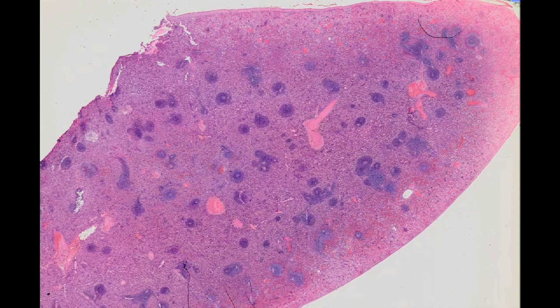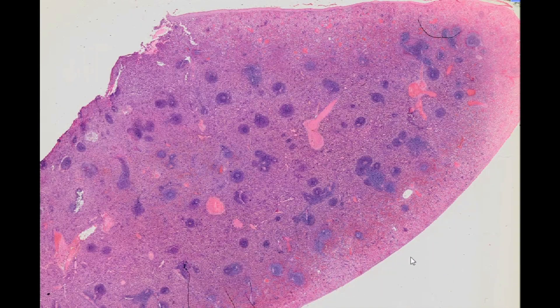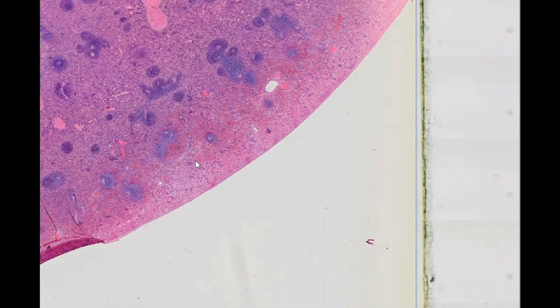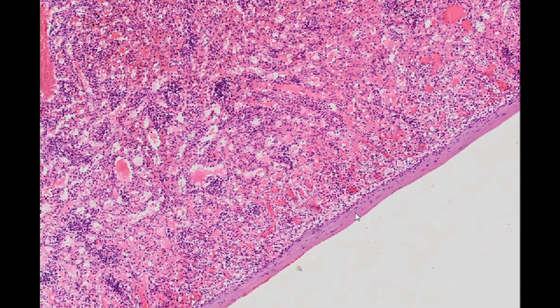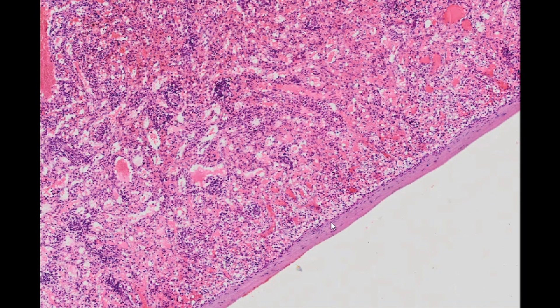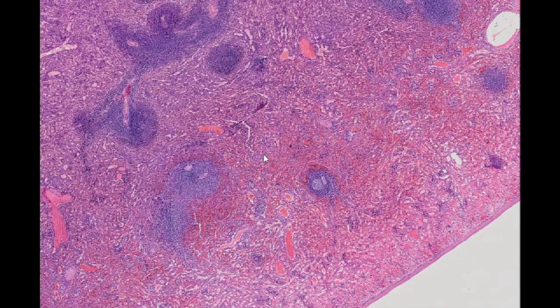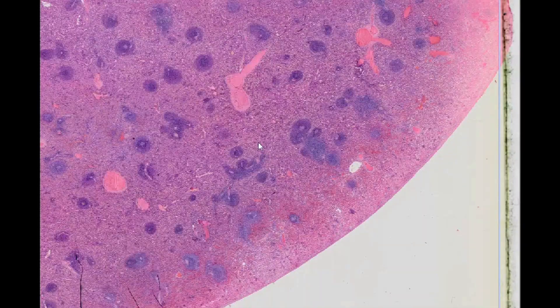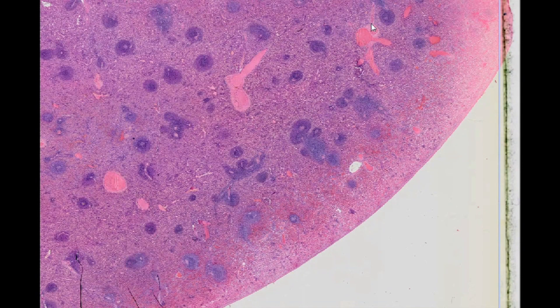Spleen. H&E staining. The spleen is a peripheral lymphatic organ covered by a dense, fibrous connective tissue capsule, whose trabeculae branch into the organ. Impressive cross sections through the trabecular veins and arteries can often be observed within the trabeculae.